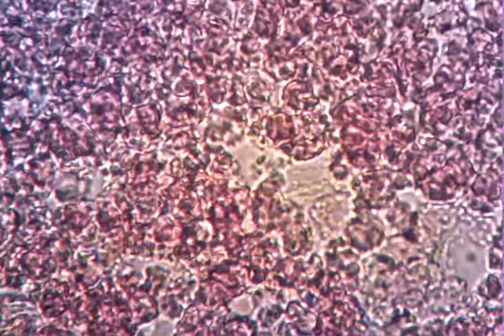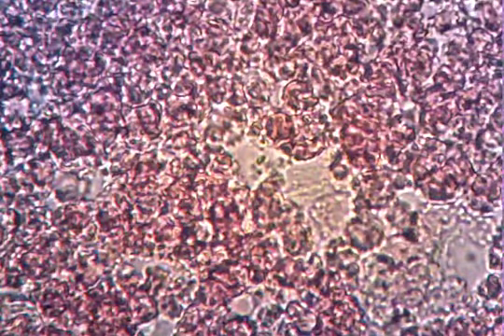All right, should we try it there? Go back to the last one. I want to see it from like... Last one, zoomed out a little more? From 100 maybe? Like that? Yeah. You want to add the salt water there? Pure water. Yeah, pure water. We're doing pure water. All right, we'll do the pure water there, and then we'll zoom in, because I want to be able to make comparisons between what we watched before.